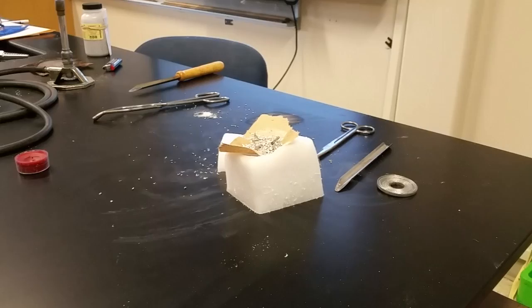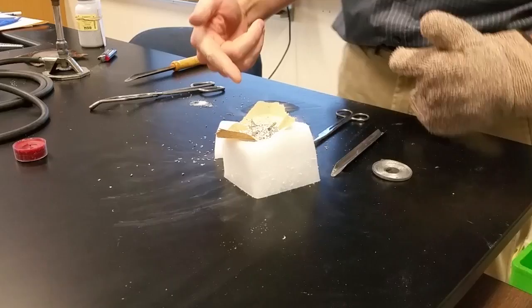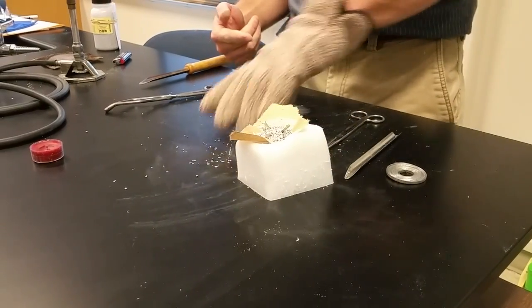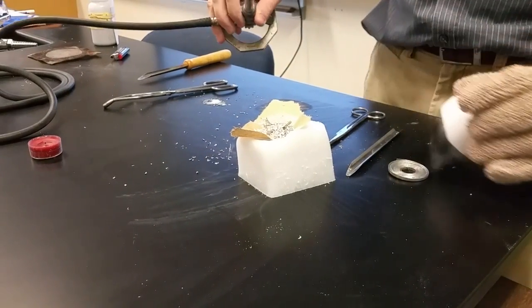Get the fume hood going. Alright, so I've got to get this hot enough to start reacting, and then I can put a cap on top of it to keep the reaction in one spot. So that's where this Bunsen burner comes into play.